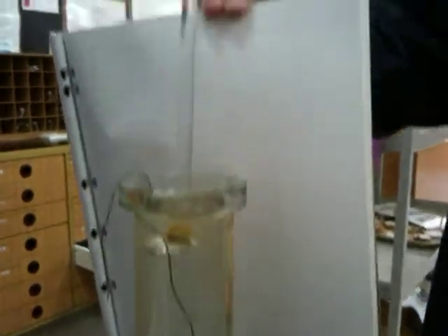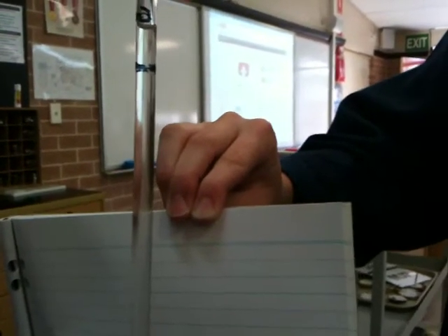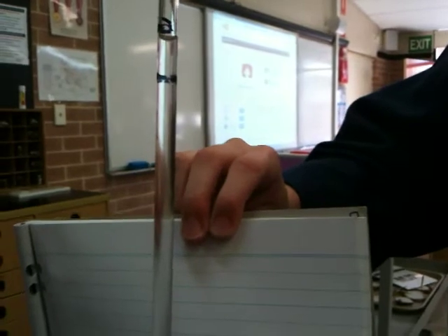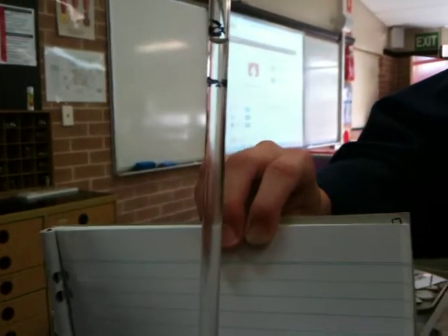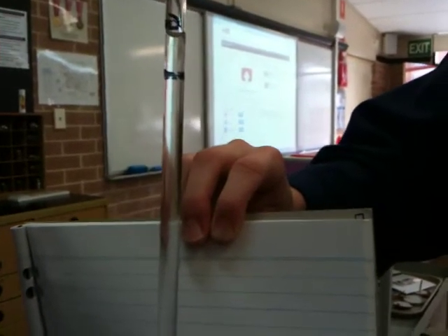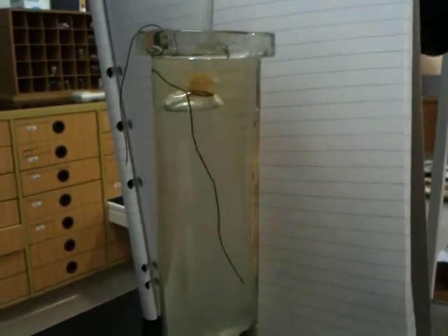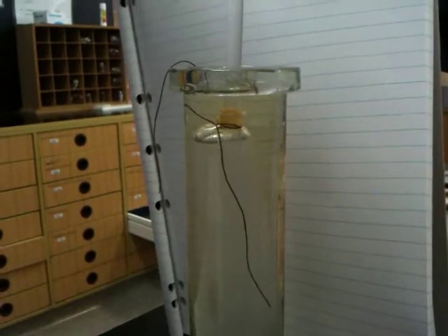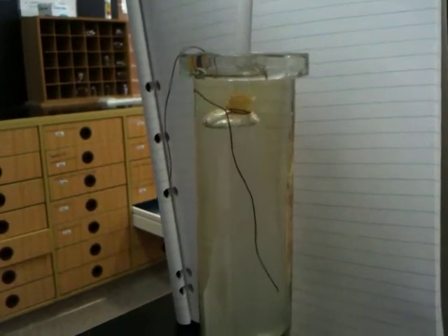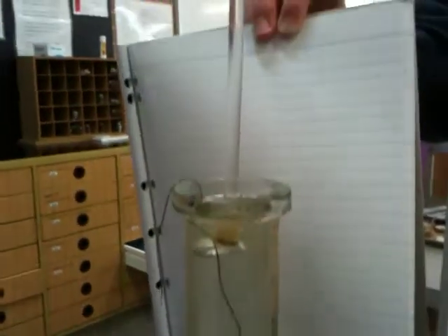And what would be the concern if, because currently the starch and water is at the top line there, we all made a mistake? What would happen if that line went up? What would that indicate? It would indicate that water is going through the bag, the semi-permeable membrane, and not just the iodine. Yeah, and so would that be bad? Yes, that would be bad because it's only supposed to selectively let things in. Good, great, okay. So let's have a look in a sec of what happened.